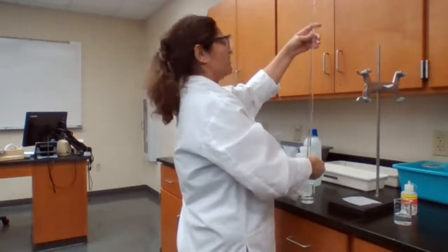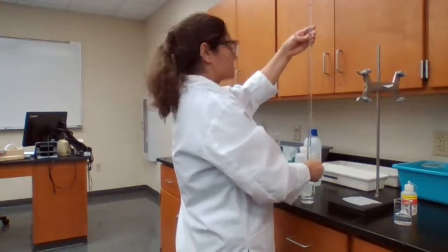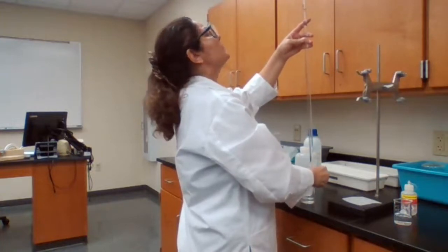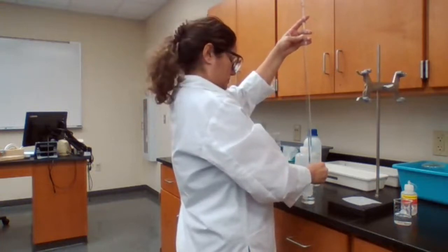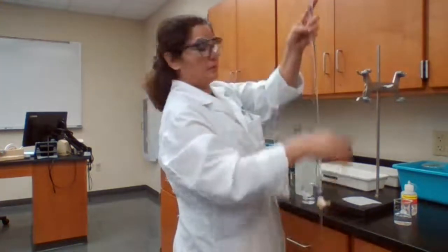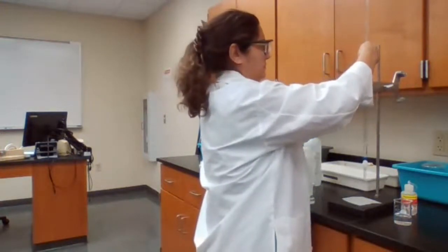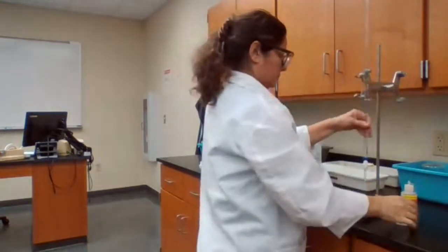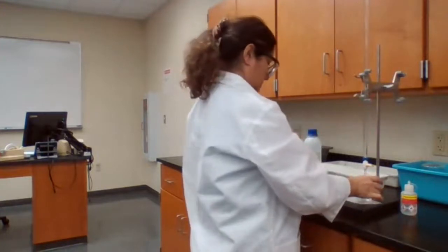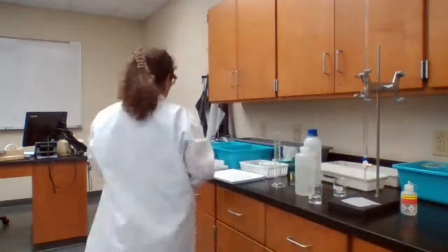Maybe I bring it to 10 so I can see it better. That's it. That's one.